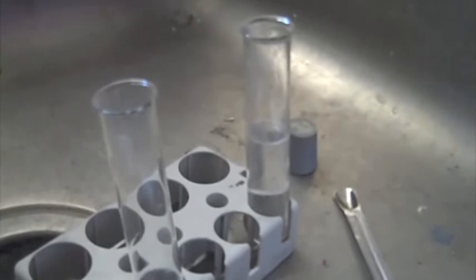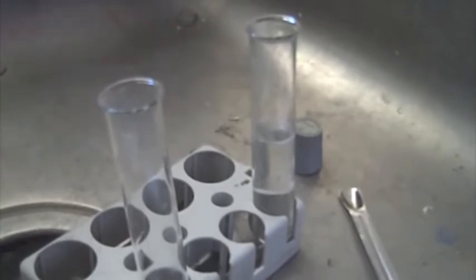Right now I'm getting some hydrogen peroxide to put in a test tube. I also can't find my hydrogen peroxide.